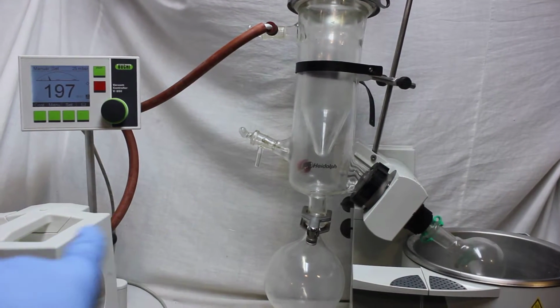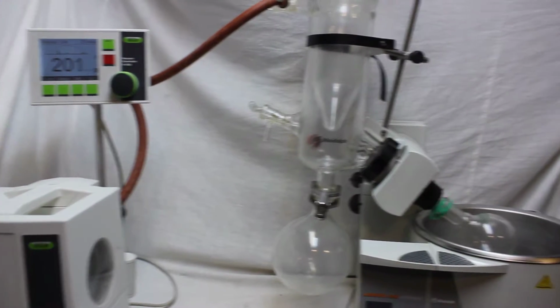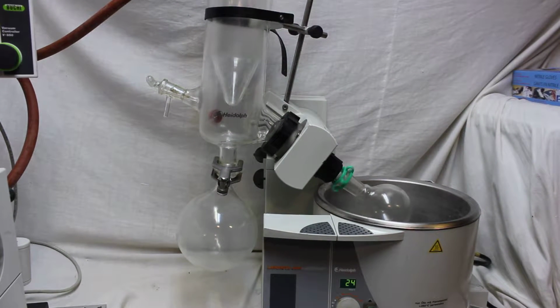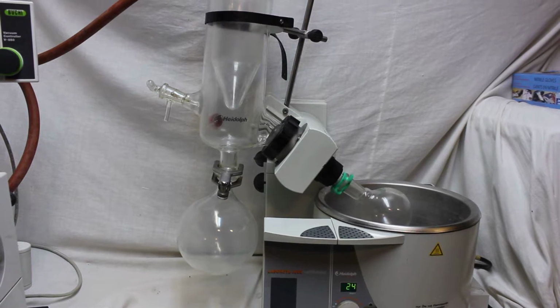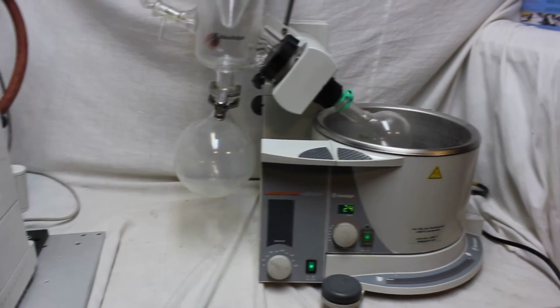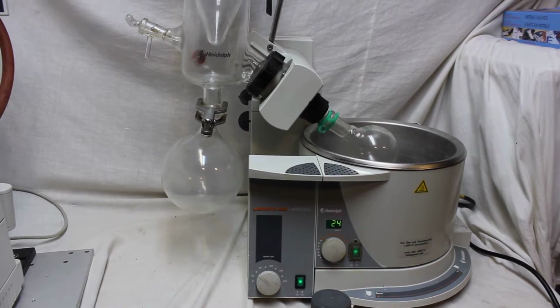That noise just comes from this Büchi vacuum pump just working. So as you can see, if I turn it, very smooth and very gentle. So it's working perfectly fine. So this is a very good piece of machinery that is just working very fine.